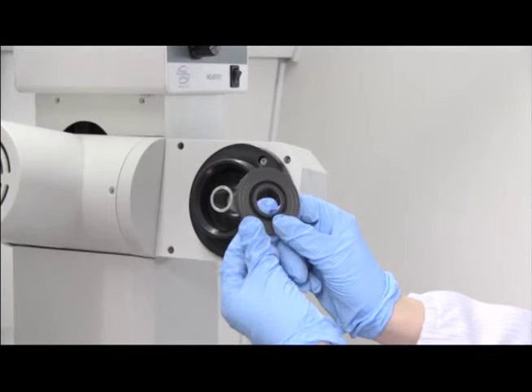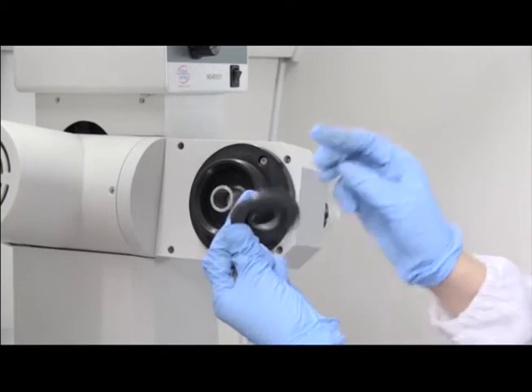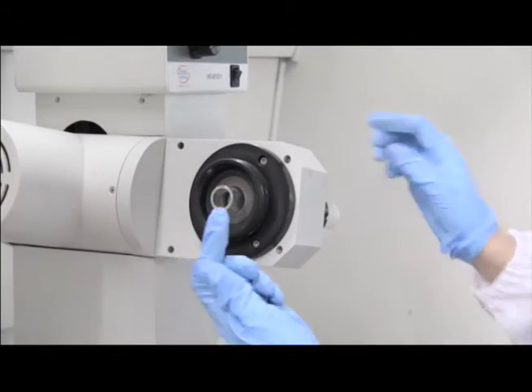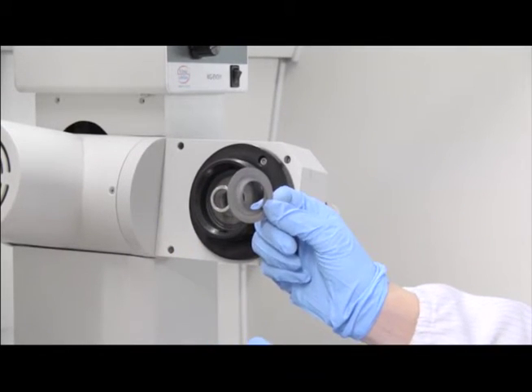First install the main black sealing ring. The black sealing ring has a groove on one side. Please make sure that the side with the groove is facing down and slide it into the vapor duct and then push it down tight.